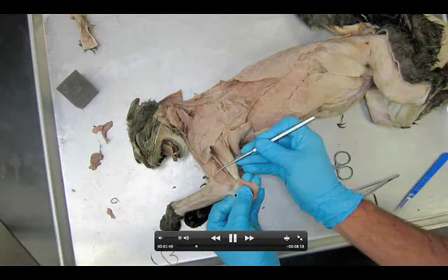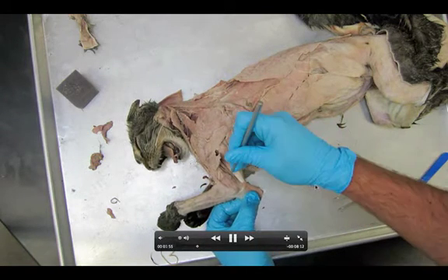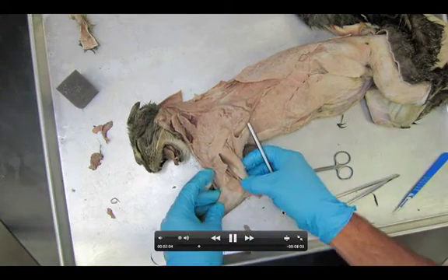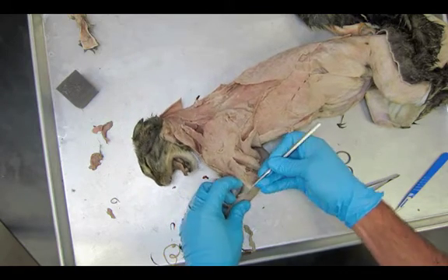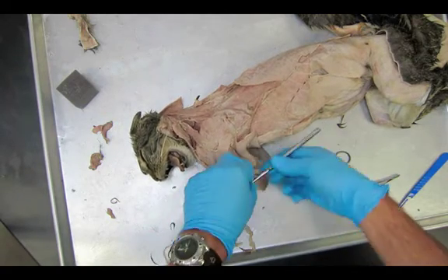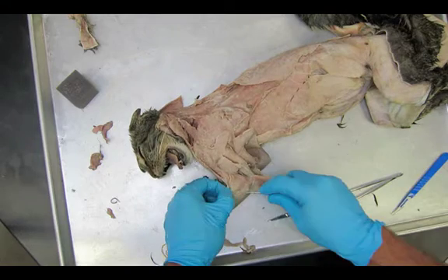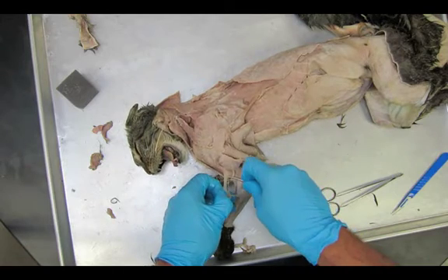Be really careful not to accidentally tear off the bottom end of the triceps brachii lateral head. The next step is we're going to be tearing up a lot of this clear stuff covering the forearm. We've got to see all of these extensor muscles. In this dissection it's the lateral arm, so it's all about the extensors. Later we're going to look on the medial arm and it's going to be about the flexors. I'm getting underneath this white connective tissue, this fascia that covers everything — it might be a little tough. I want you to be careful to pull this off without teasing apart the extensor muscles. I'm going to get my probe under here and find that brachioradialis.